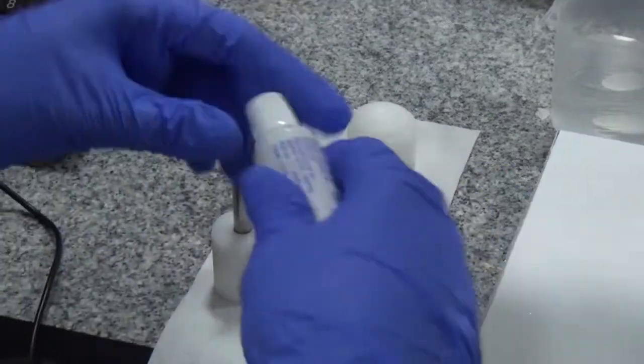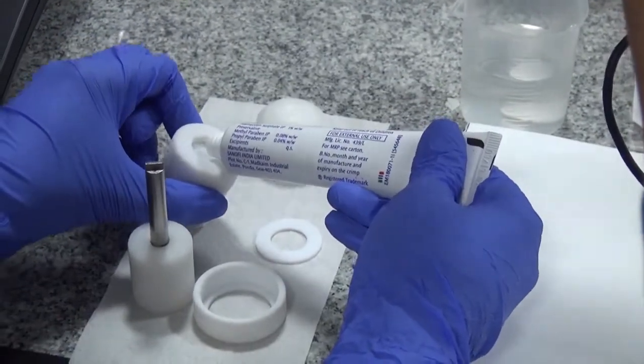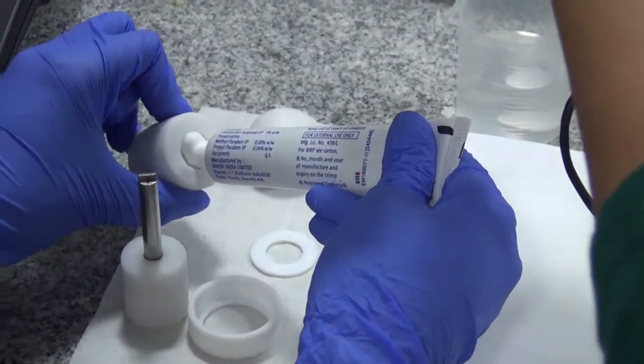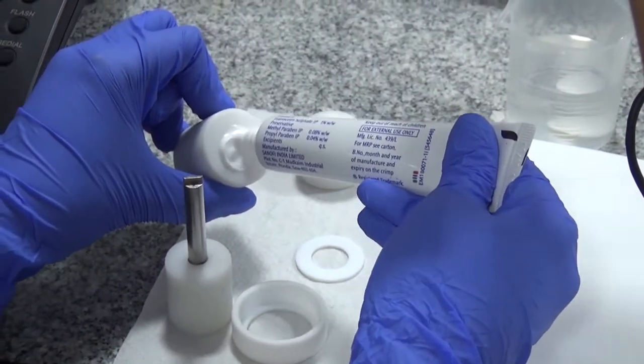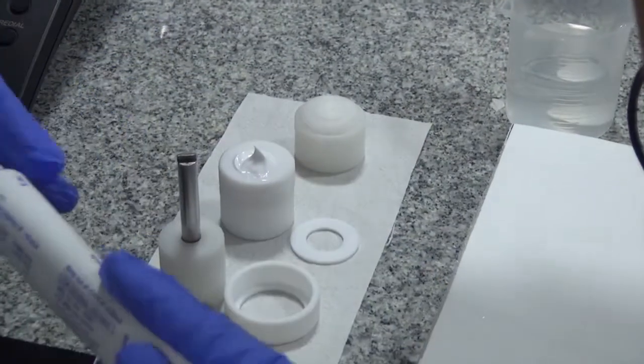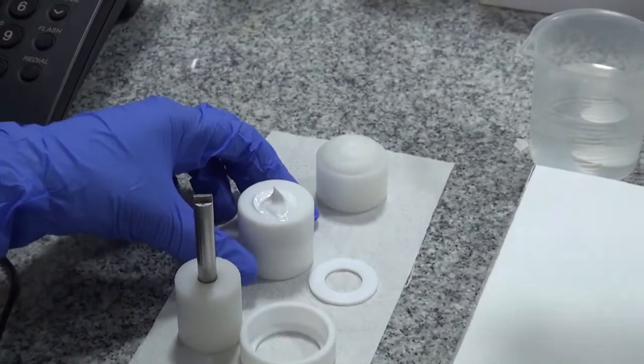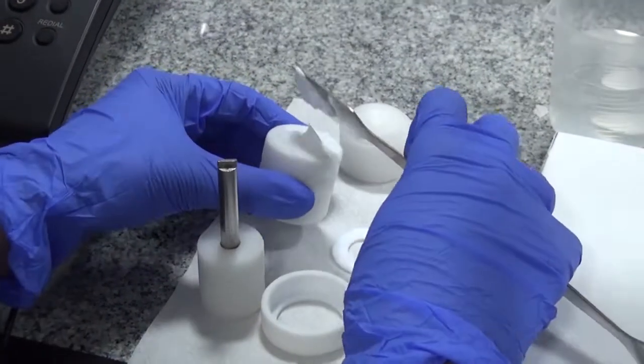the ointment first. We add excess ointment, more than what is necessary, and then we scrape off the excess.